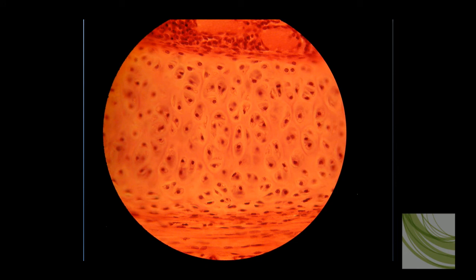Alright, here is that last slide at 40X objective, and at this objective and magnification we can see the lacuna, we can see the chondrocytes. Now the lacuna are packed a lot closer together in this slide than in the first slide we looked at, but the one characteristic that is constant is this smooth matrix between the lacuna. You don't see any fibers there. If you don't see fibers, you see the little cavities with chondrocytes in them, you know you're looking at hyaline cartilage.